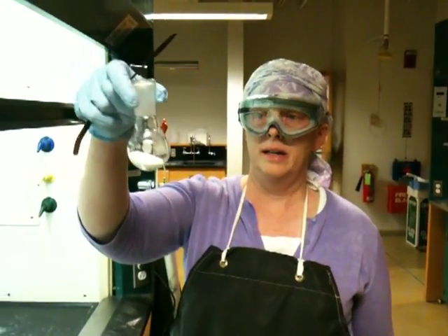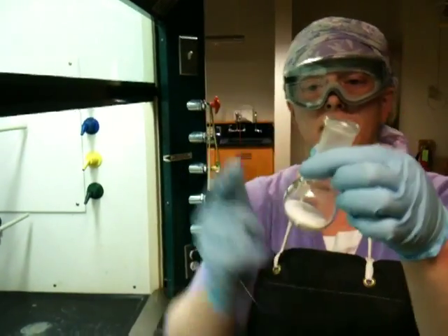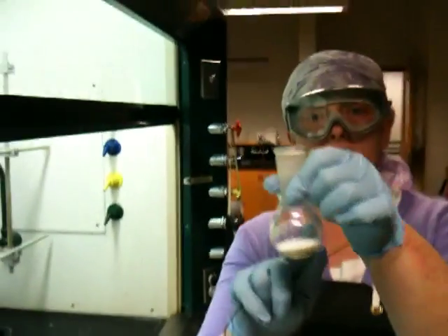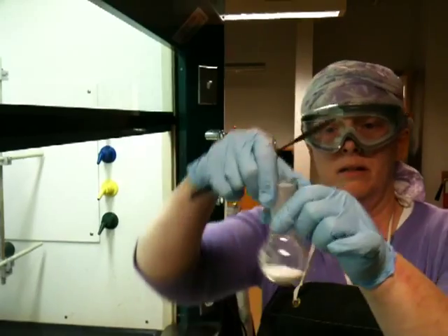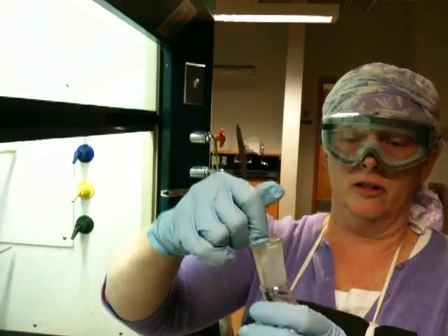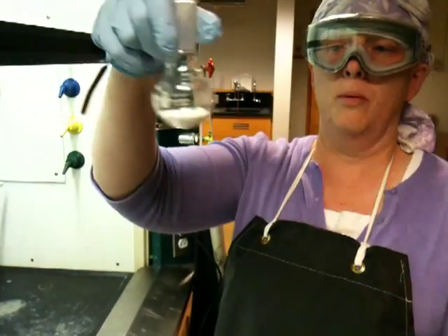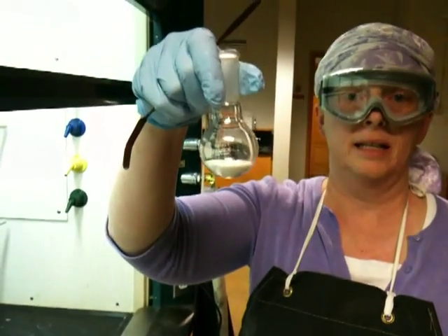You're also not allowed to drink or eat in lab — I've been picking up a lot of coffee cups and water bottles. At the end of your caffeine isolation process, you will have a solid in a round bottom flask similar to this. However, your solid will be stuck all over the sides of the glass. This is a loose solid. What you'll have to do is take a spatula and really loosen up that compound and get it to a point where it's laying on the bottom of the flask.